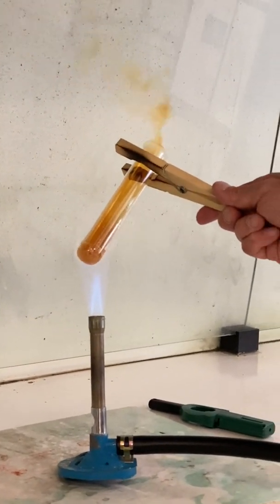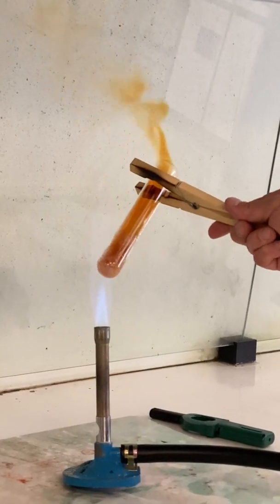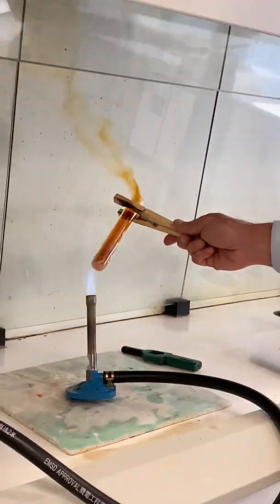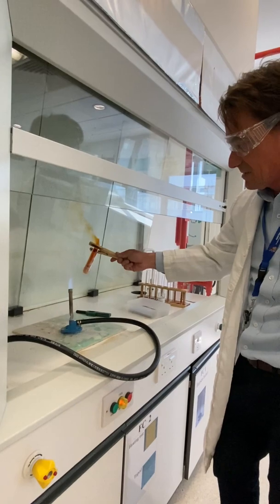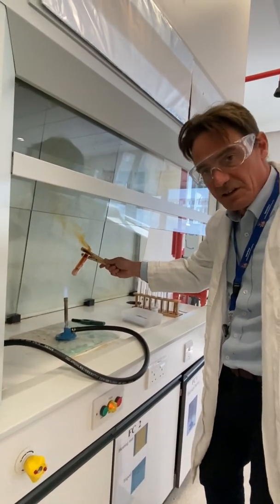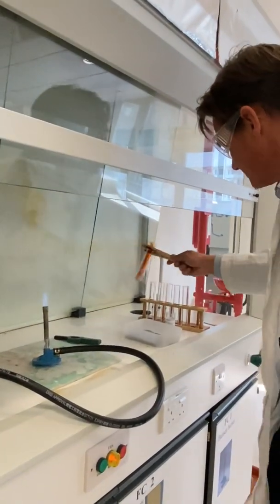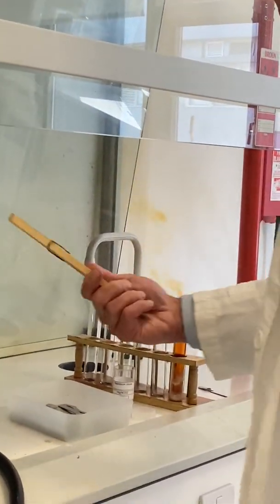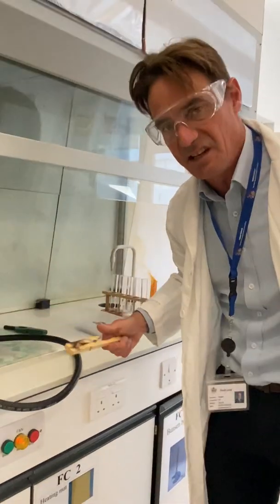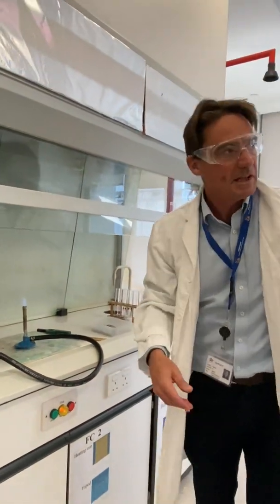Now, whenever you see brown smoke, a lot of people are tempted to say bromine has been formed — that's obviously not bromine, that's nitrogen dioxide coming off there. The nitrate ion has been pulled apart to form nitrogen dioxide and also a little bit of oxygen. I'll just put that in the fume cupboard. Obviously nitrogen dioxide is an acidic gas and a respiratory irritant.